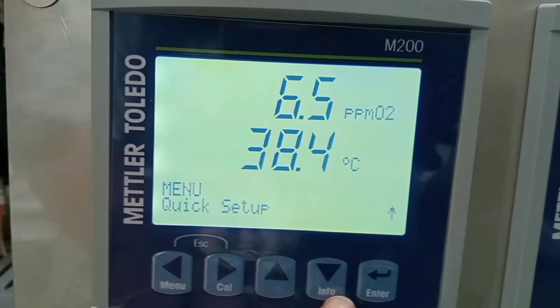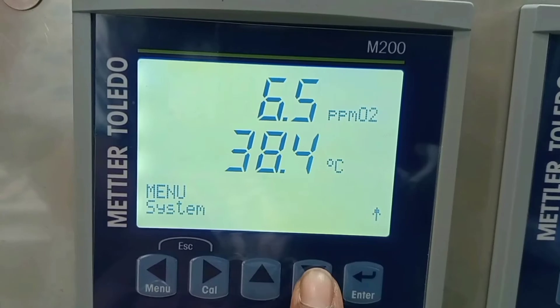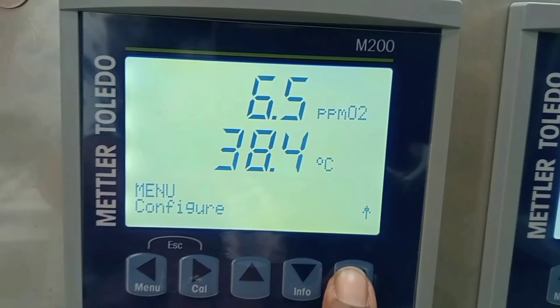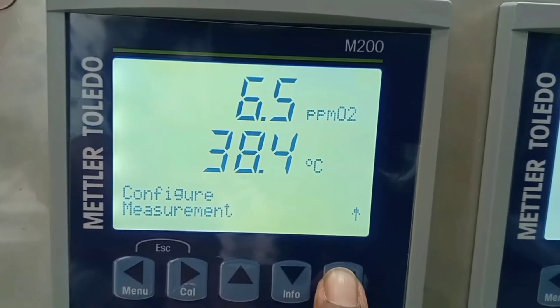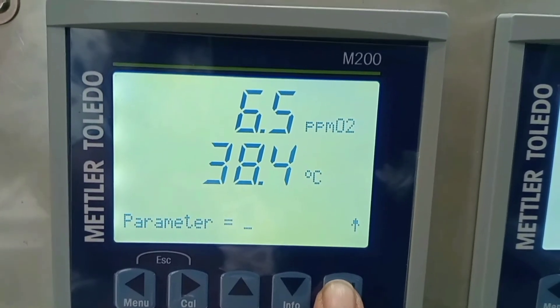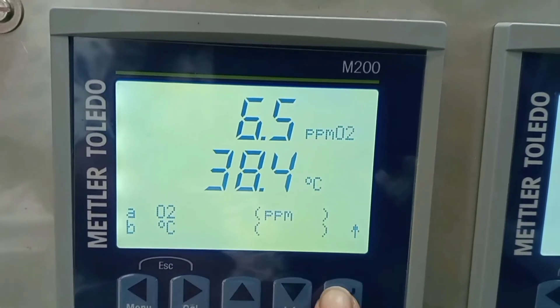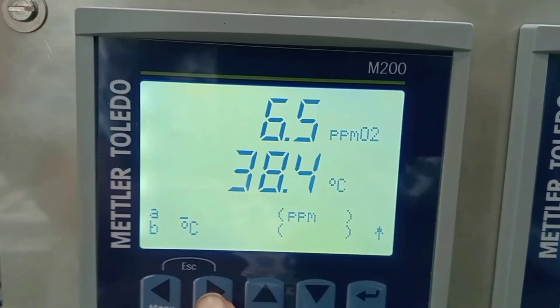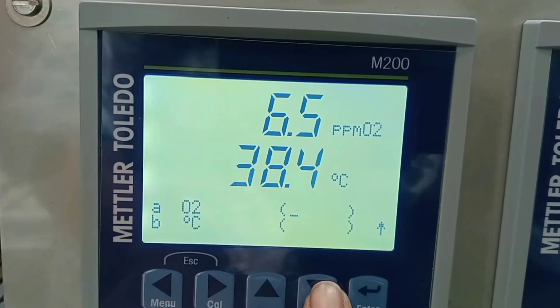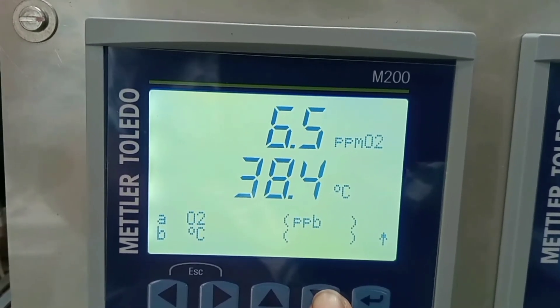After this setting, navigate back to the menu screen and select configuration. In configuration, select measurement and enter. In channel setup, select the parameter. Out of the various parameters, I am selecting O2 high, same as the previous setting. For the unit of measurement, I am selecting auto.